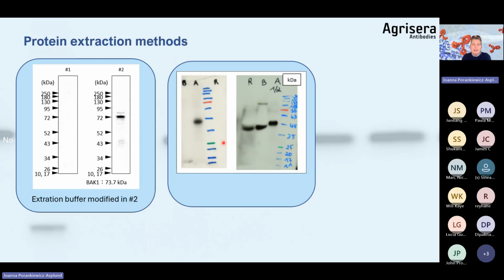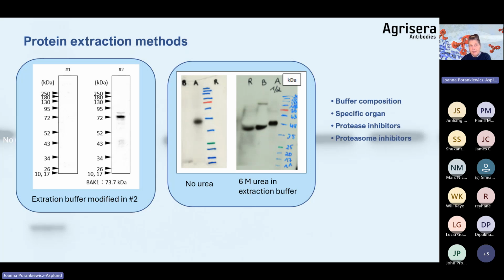Another example: we have 3 species, barley, Arabidopsis, and rice, and the target protein was detected only in Arabidopsis. The sequence is conserved in all 3 species. What happened in this experiment is that 6 molar urea was included in the extraction buffer, which allowed unfolding of the target protein and allowed the antibody to bind. So, in case there is no band, please don't panic. Analyze your buffer composition, check if you have used the proper organ, if you included protease inhibitors. For some proteins, even proteasome inhibitors are important because some proteins can be targets of proteasomal degradation.